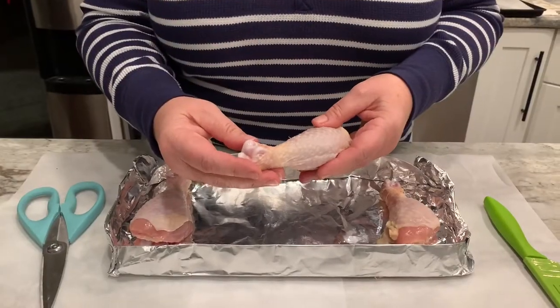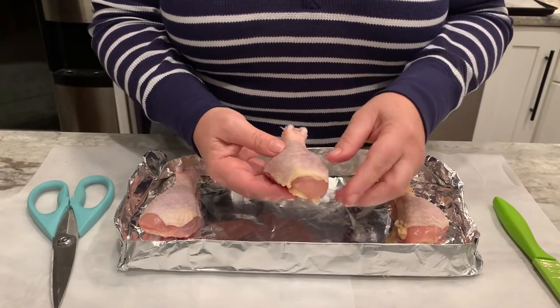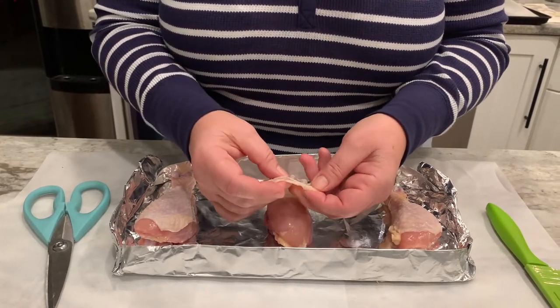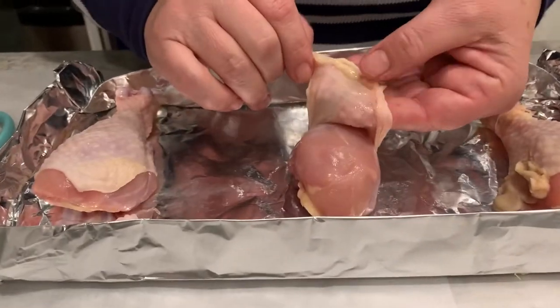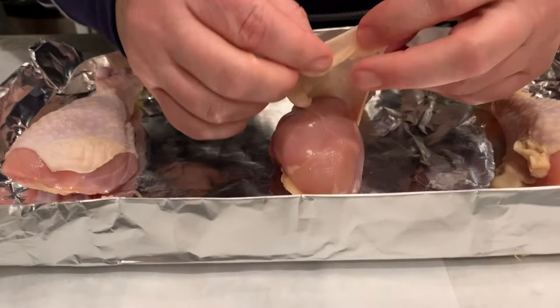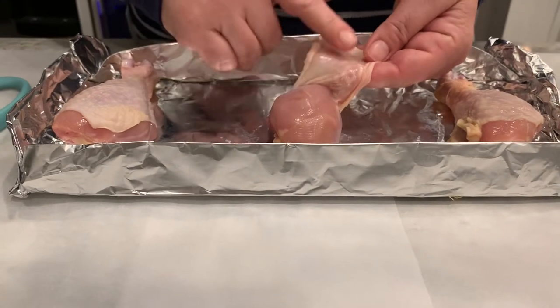This is the skin — this is epithelial tissue, specifically the epidermis. Notice how thin that membrane is. Underneath, that yellow you see is the adipose tissue or the subcutaneous layer. It's hard to see the follicles and blood vessels at this scale, but you can see the epidermis and the subcutaneous layer.